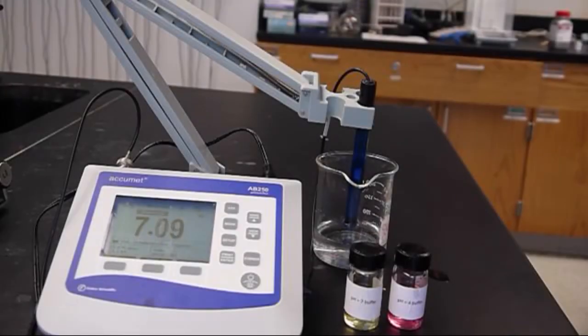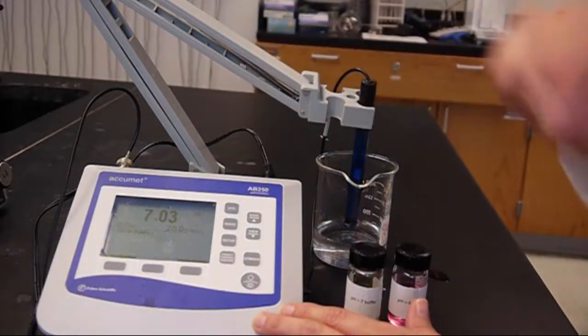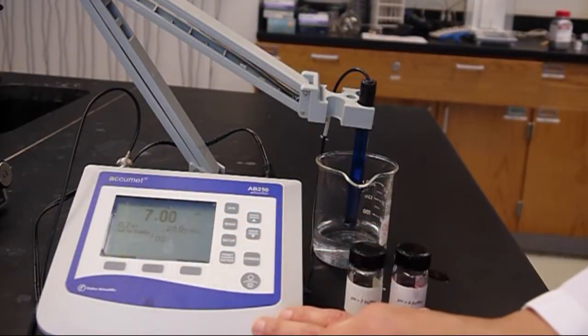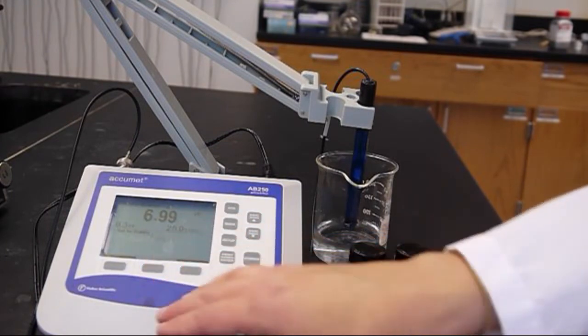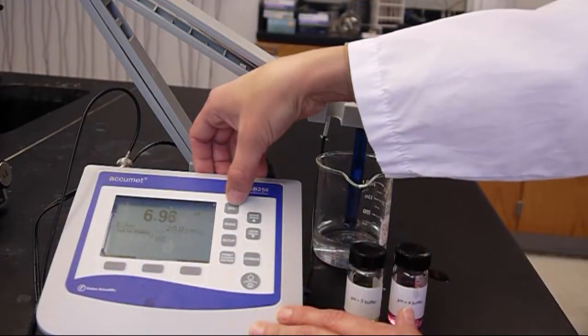I have instructions on how to do this for you. It does need to be done at the beginning of every lab session. One thing to do first is check that there is no calibration built in. If there is you can clear that in the standard STD mode.